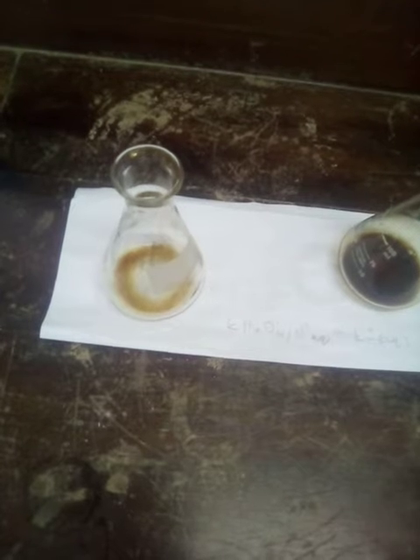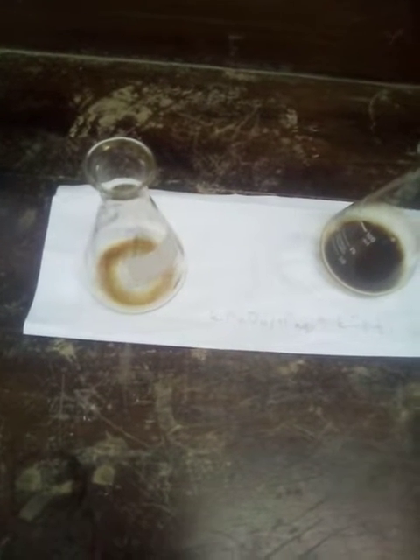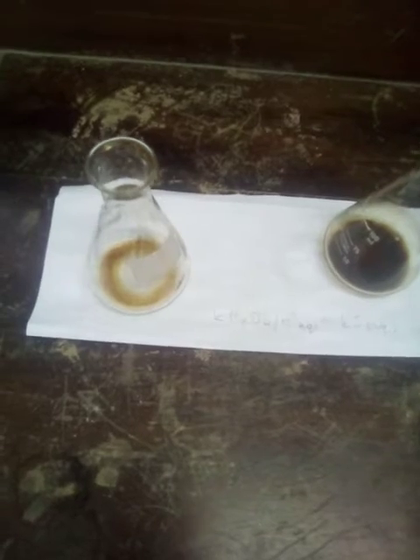Right? And if a redox reaction took place between the acidified potassium permanganate and the potassium iodide solution, then we will determine based on the reaction that we will see here. So we are going to use starch solution to react it with the contents that we place in the other clean conical flask and see what is the result.